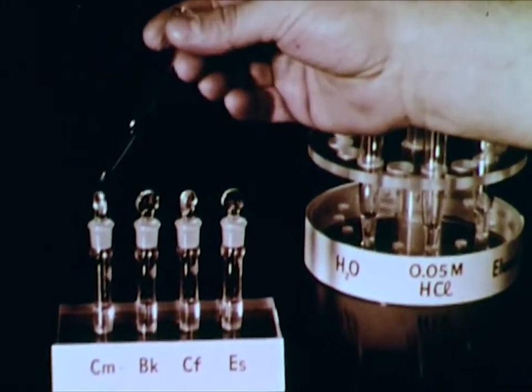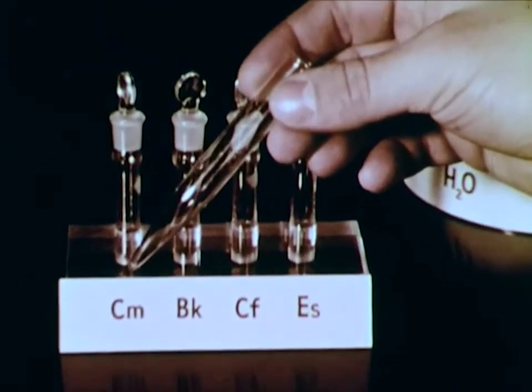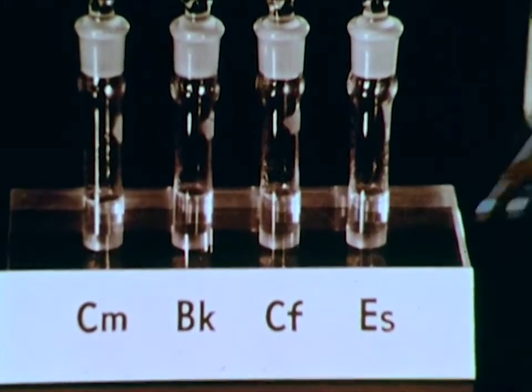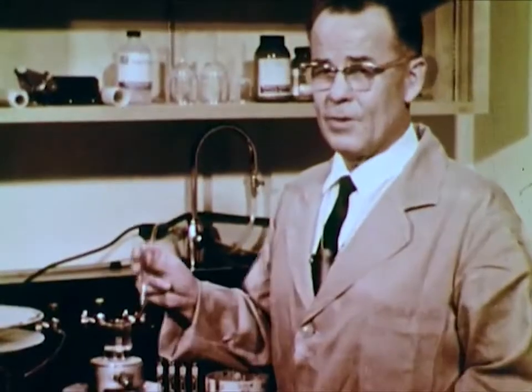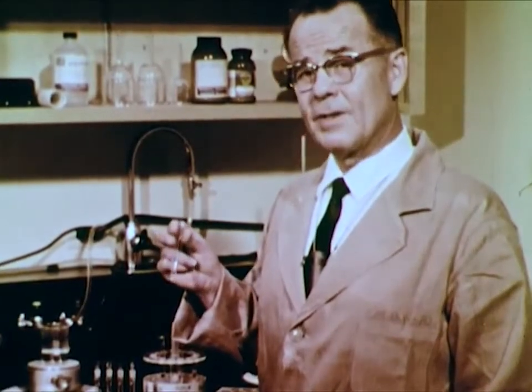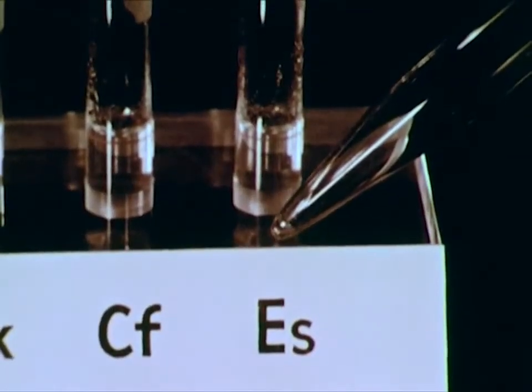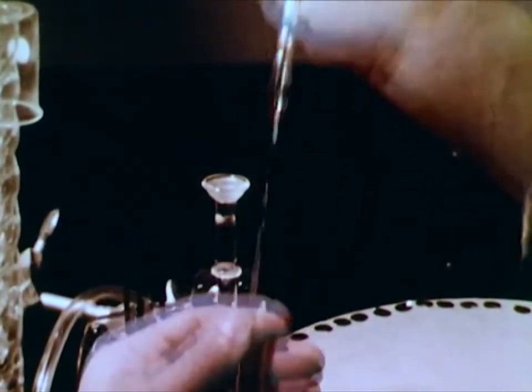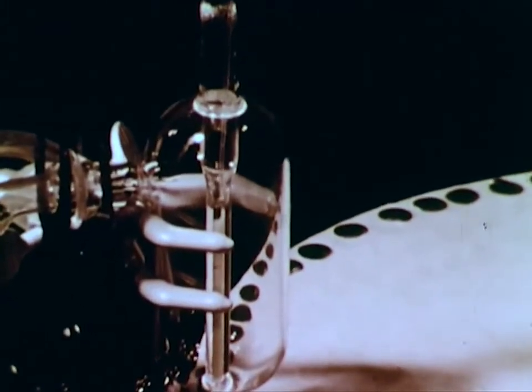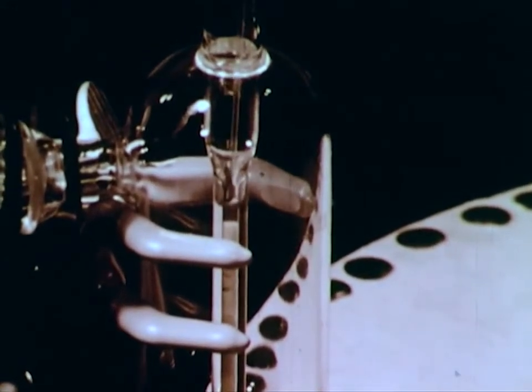Here's a solution containing equal amounts of tri-positive ions of four of the synthetic elements: Curium-244, Berkelium-249, Californium-252, and Einsteinium-253. We should mention that only small amounts of these elements actually exist. For instance, at the time of this filming, there is only about one-tenth microgram of Einsteinium in all the laboratories on Earth. We're working with small amounts of these elements in extremely dilute solutions of concentration about 10 to the minus fourteenth molar.